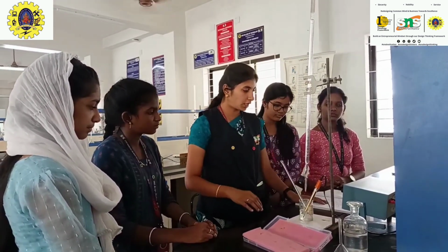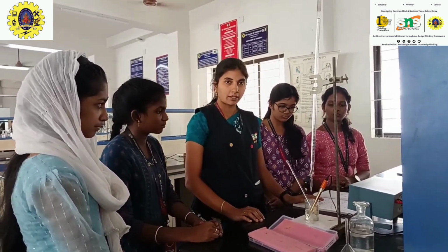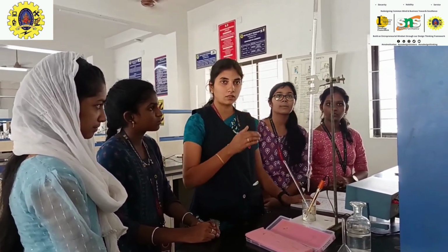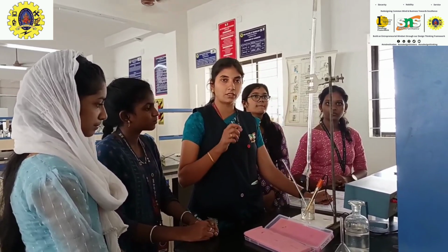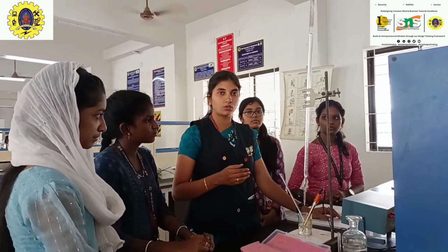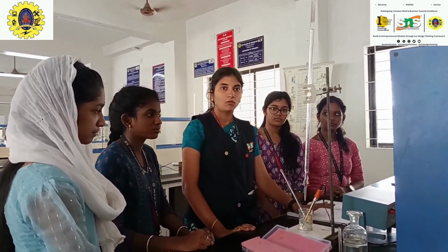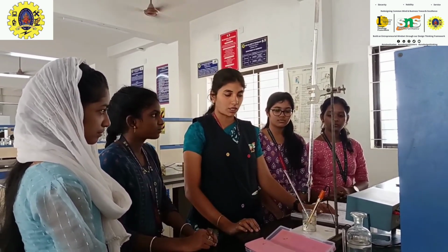The value changes to 6.16. Likewise, the values change as sodium hydroxide is added, the first change corresponding to HCl and the second to acetic acid. This is how the values vary for the strong acid and the weak acid.